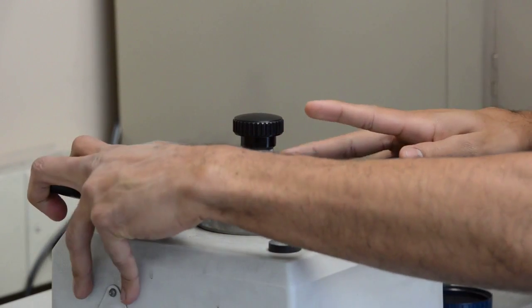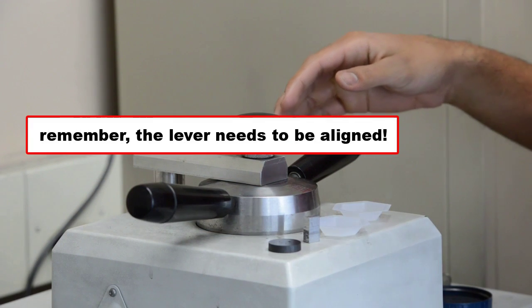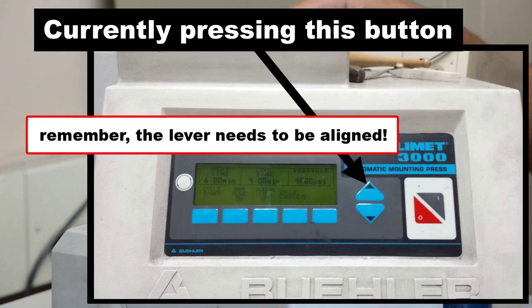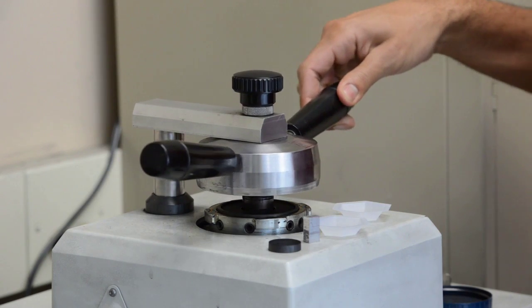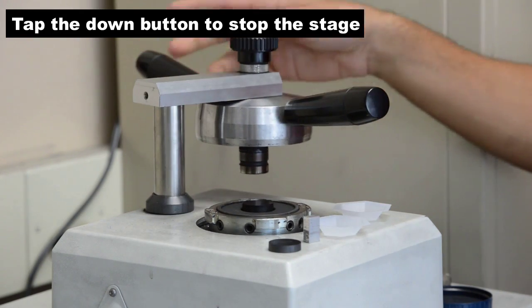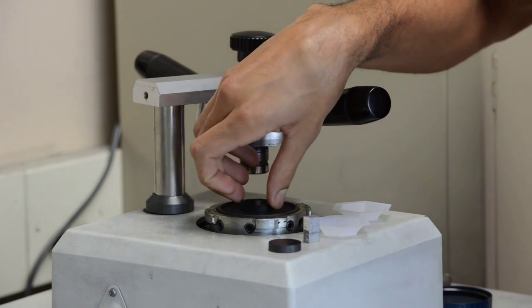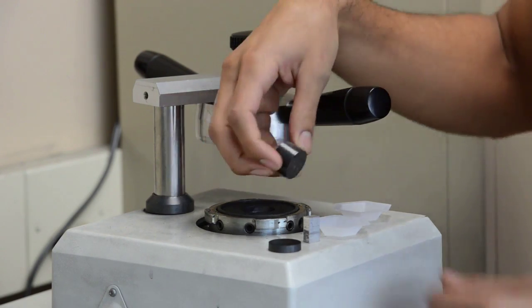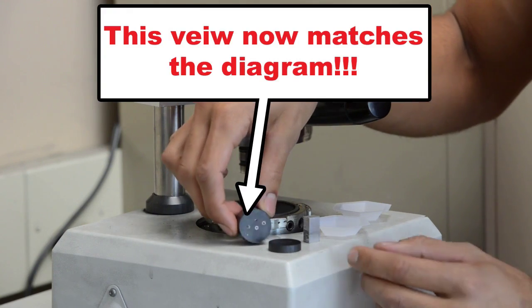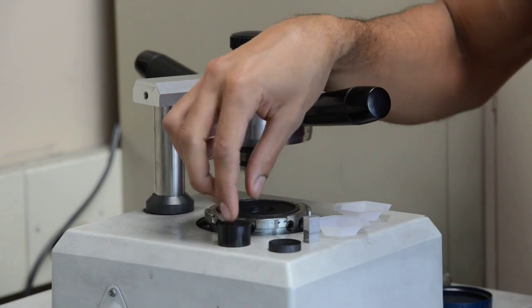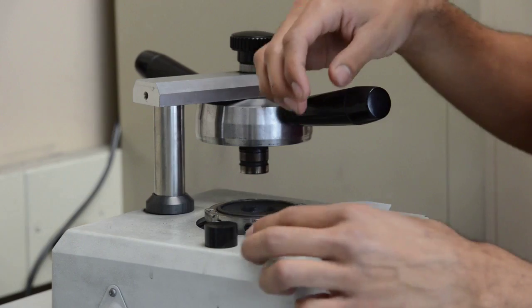So this is done. Let me take my sample out. And here's my puck. Those are my samples in there. And this is a pretty solid puck.